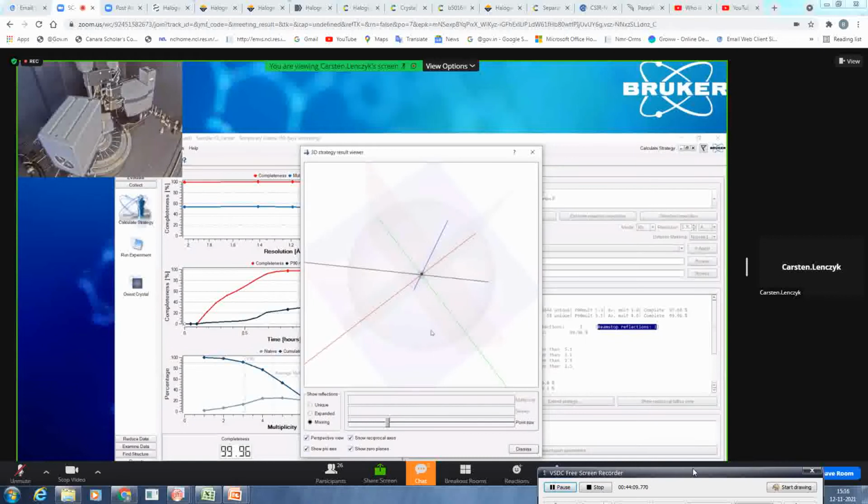Another interesting feature in this is you will see the phi axis. This is the black one. You can activate, deactivate it. Especially for needles, that can happen with the MiTeGen loops, they will slip through the force and will perfectly align themselves to these MiTeGen loops. And then most of the time you have aligned one of the axes to the phi axis. And if you then try to measure P1, there will always be a cone of reflections that you can't reach. So always be aware, if you have low completeness calculated and you don't know why, then it is always worthwhile to check this reciprocal lattice view and check if this phi axis is aligned with one of the axes you find here.